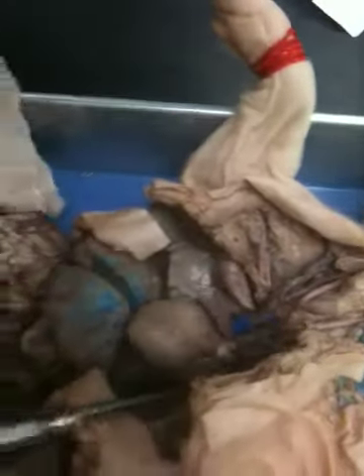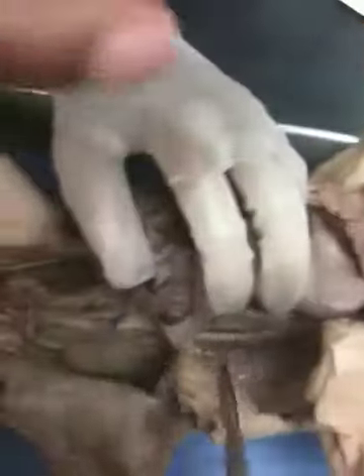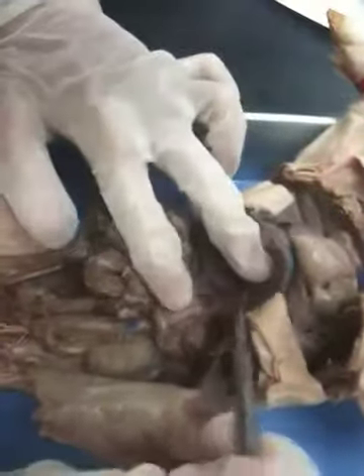Okay. Subscapular, which goes deep after the axillary, and it's the only one that breaks off. Then the azygos, which is the blue one, right next to the descending aorta. And the hepatic veins, which come off from the liver.